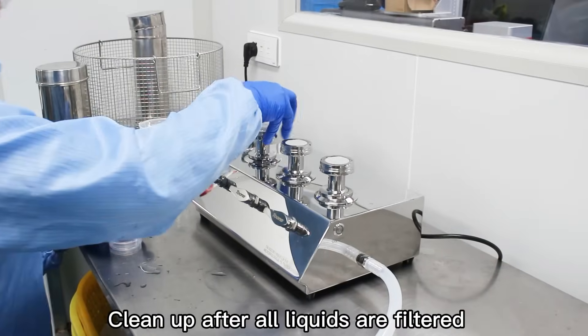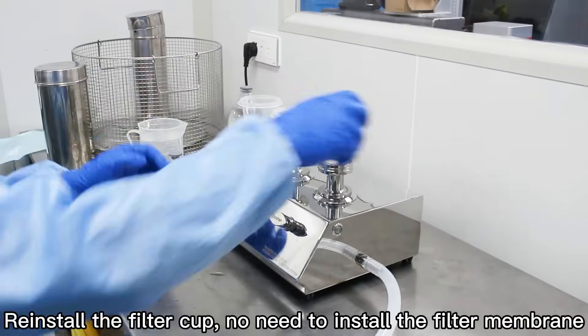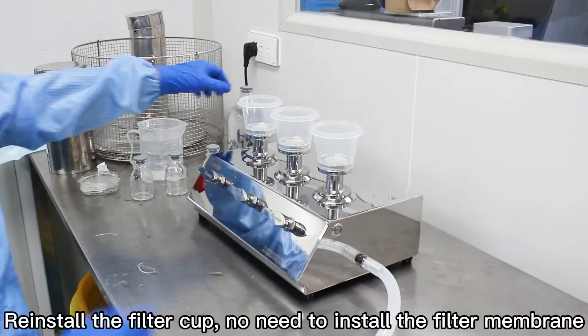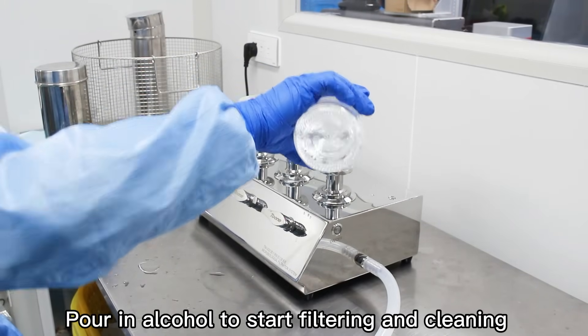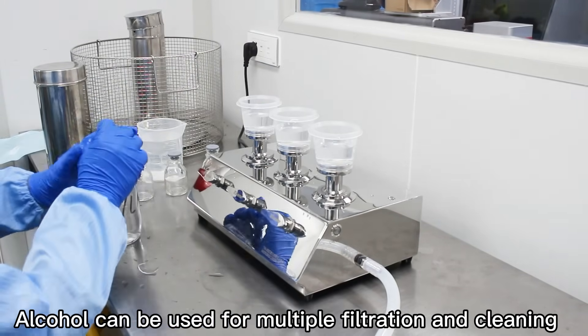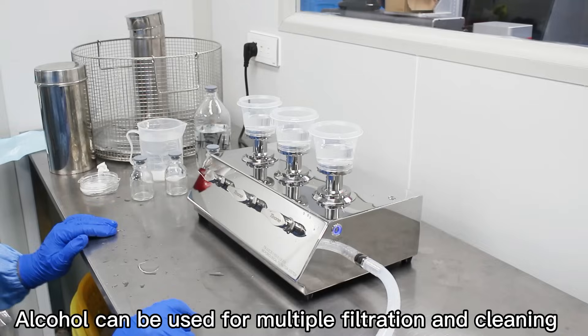Clean up after all liquids are filtered. Reinstall the filter cup. No need to install the filter membrane. Pour in alcohol to start filtering and cleaning. Alcohol can be used for multiple filtration and cleaning.